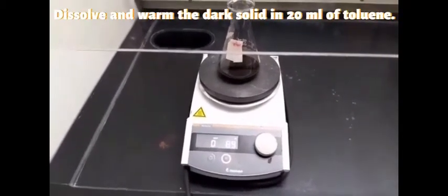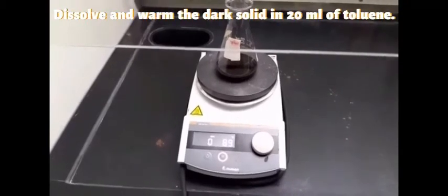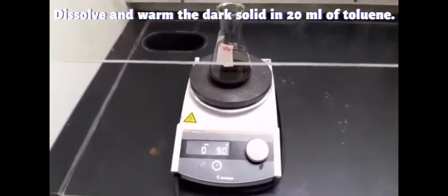This is the purification step where the dark solid, manganese 3 acetylacetonate, after drying in the vacuum desiccator, will be dissolved in around 20 ml of toluene, and this solution will be warm. After the solution is warmed, we'll filter and cool in an ice bath to obtain the crystals. We also have another flask of warm toluene, prepared for rinsing purposes.